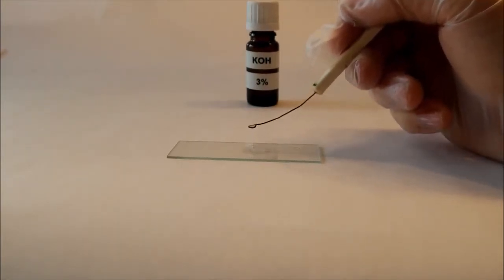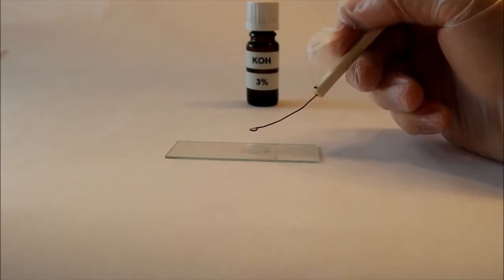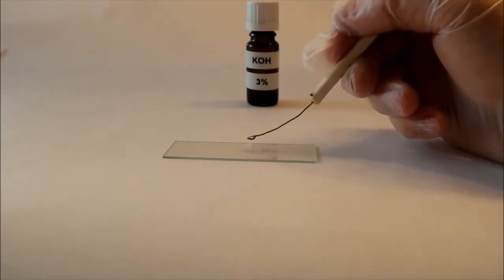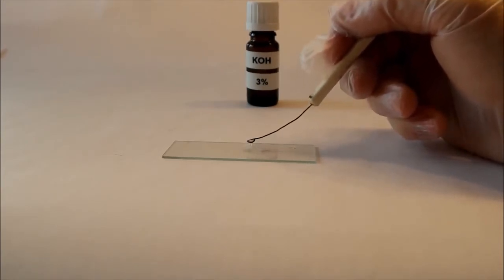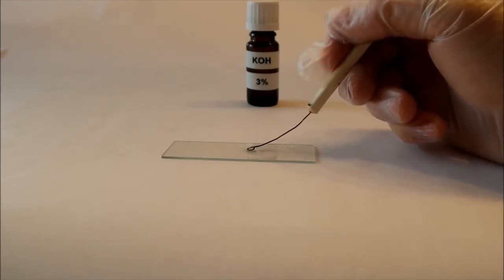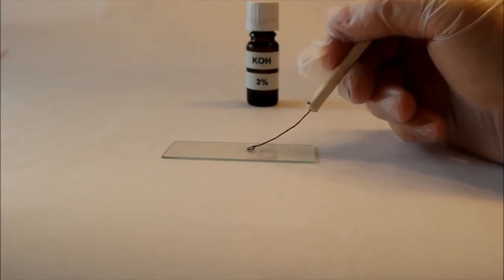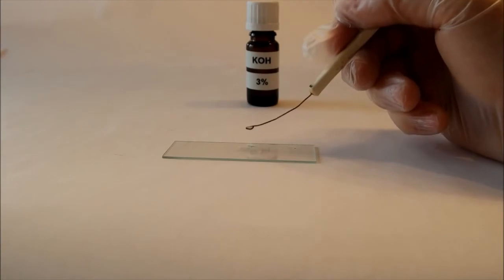Yeah, this really seems to be gram-negative bacteria, because I can clearly see these lines of DNA. I prefer this test to the classical gram stain because it's pretty reliable and it's easier than the gram stain. It's faster and more practical, I think.